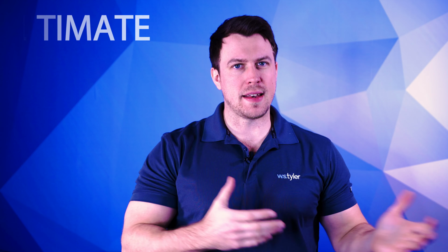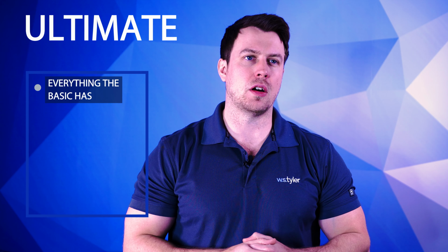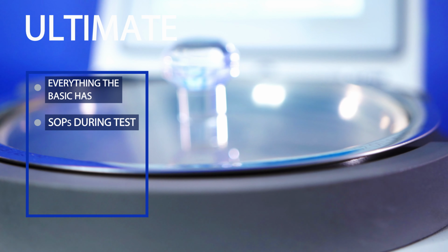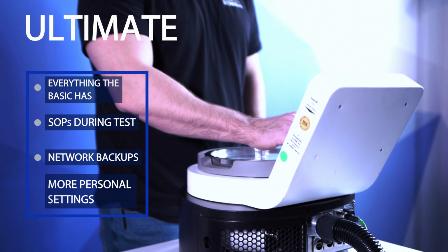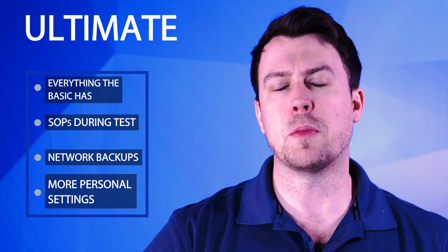The Ultimate is going to be the next level of software. It's going to give you a little bit more functionality. So, for example, it's going to give you the option to use SOPs when running tests, so you don't have to manually select everything. It's also going to allow you to back everything up onto a network. All your test data can be saved on a drive. It's also going to give you a little bit more personalization in the menu, what you select, the units, and so on and so forth, just a little bit more than the Basic. The Ultimate's going to come in at around $14,000 to $15,000.